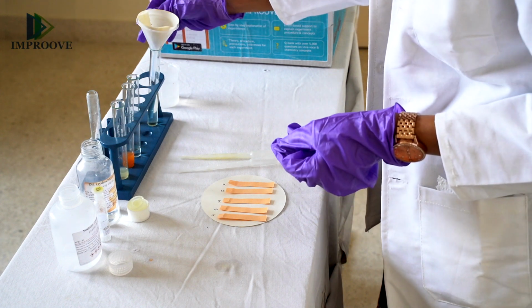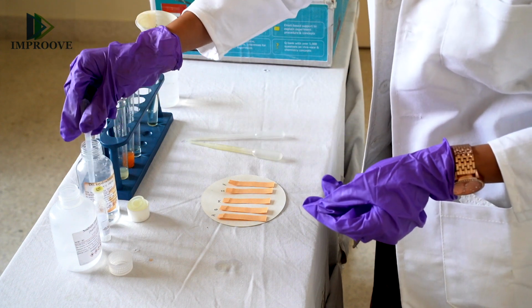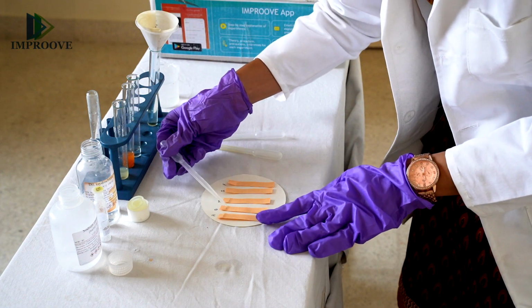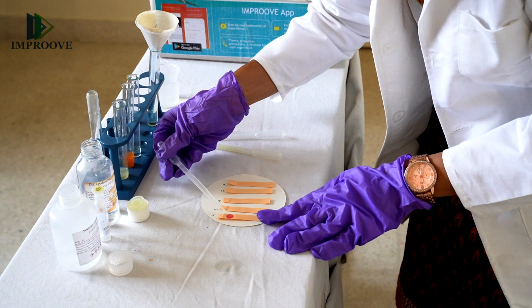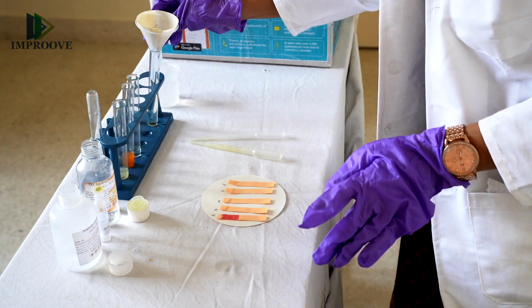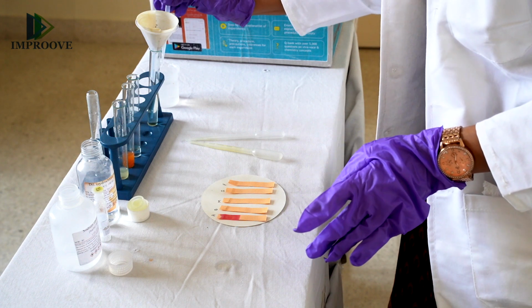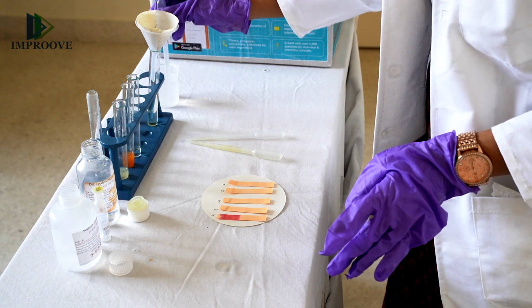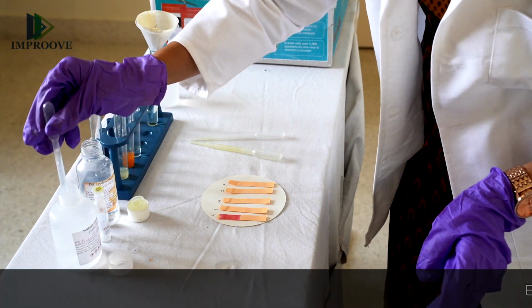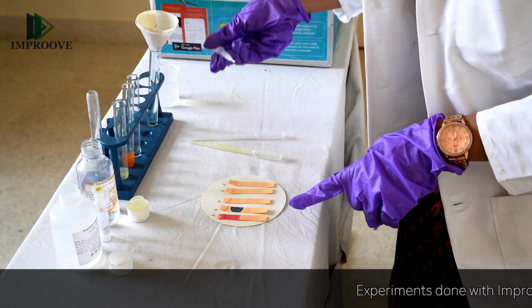and just change the dropper. And very gently, pour about 1 or 2 drops carefully, and notice the color change of the pH scale. Similarly, we will repeat this for the base, which is our dilute sodium hydroxide solution. Put it on the second strip and notice the color change.